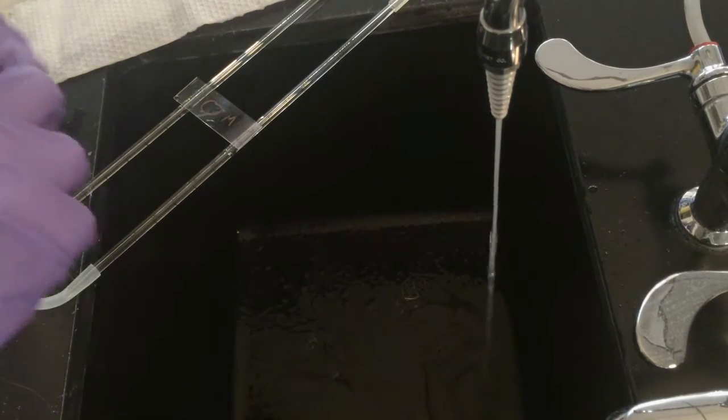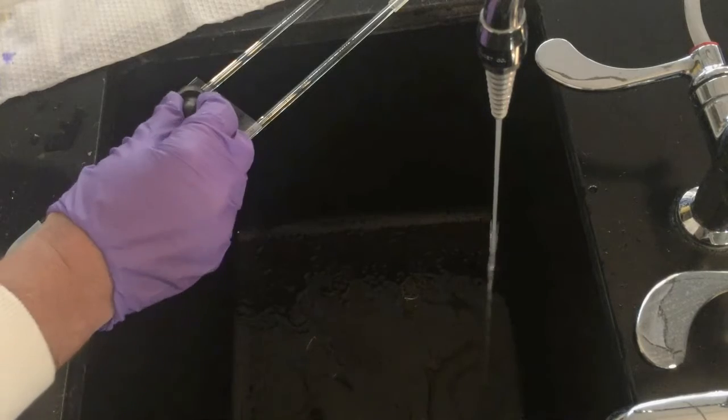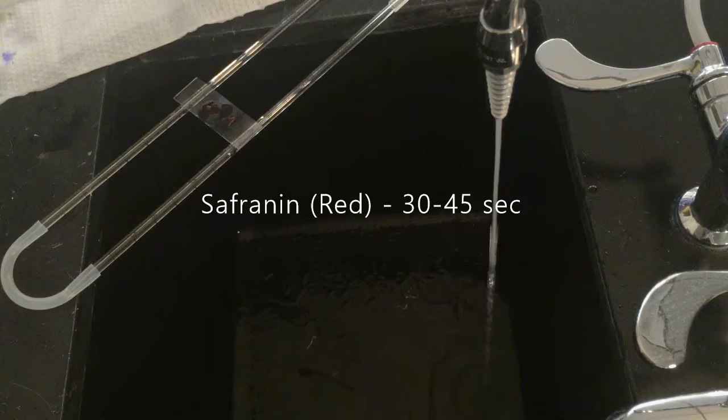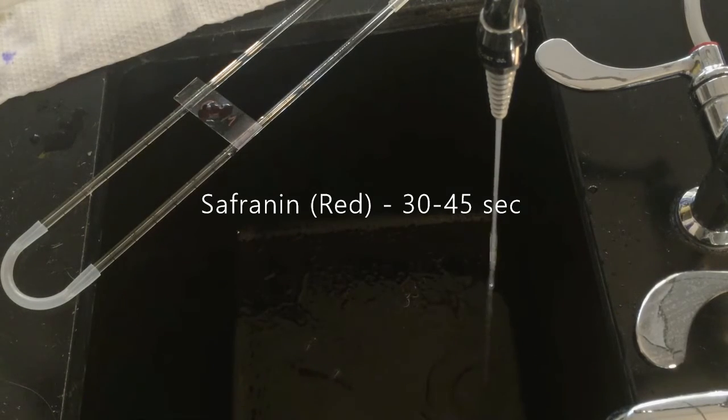Similar to the other steps, you put the stain onto the bacteria. In this case, I'm not going to leave it quite as long as one minute, maybe 30 seconds to 45 seconds.